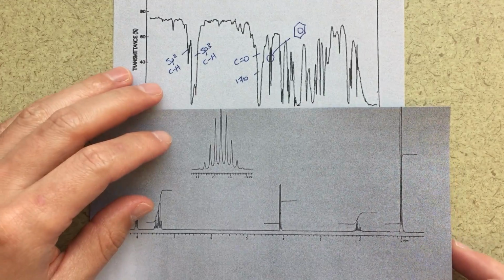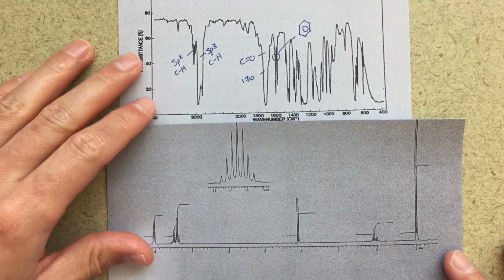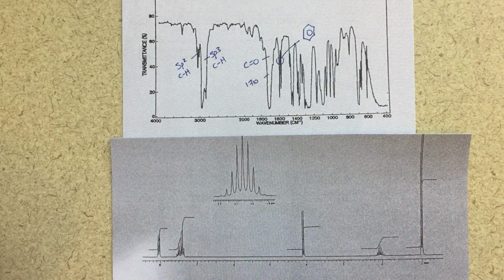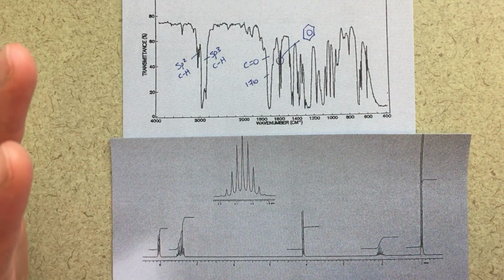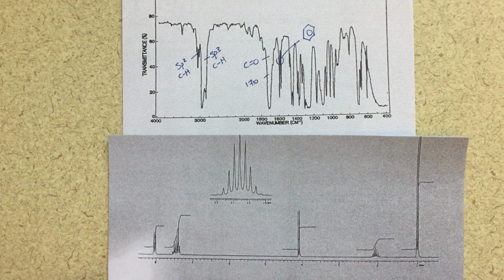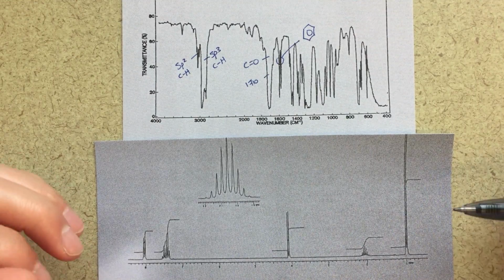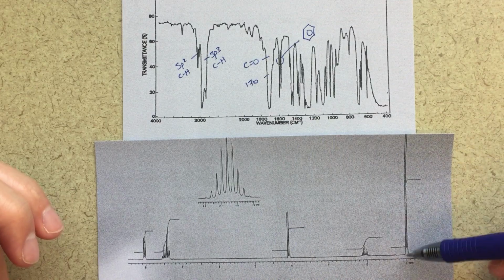All right, let's look at this NMR. So again, the IR and the NMR, I think those are the best starting points. Let's make sure we can see everything here. And looking at this NMR, again, the first thing I'm going to do is try to find things that really jump out at me. I think that oftentimes we're tempted to solve everything at once, but we really need to take it step by step and be as methodical as possible. So in the NMR, the thing that really jumps out at me first and foremost is this huge doublet.